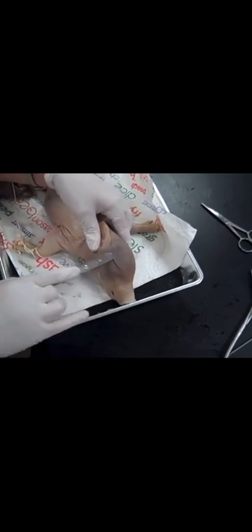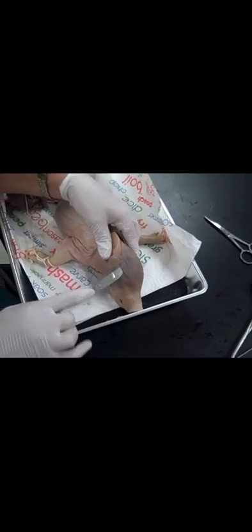After you have made this incision, slowly peel off the skin from the head to view the skull. The skin will be tightly attached to the skull, so loosen it as you pull the skin. This will take time.